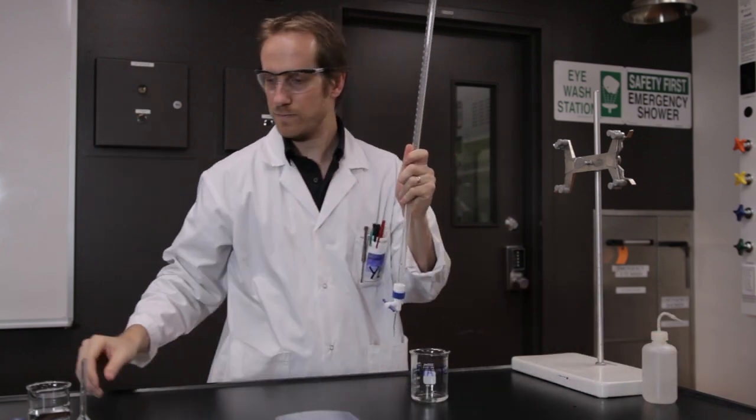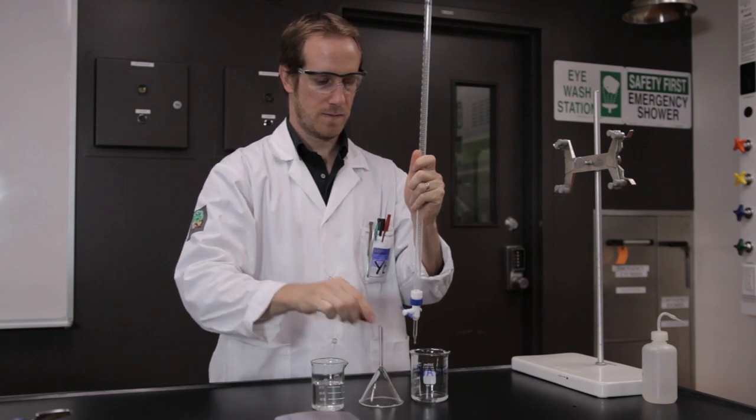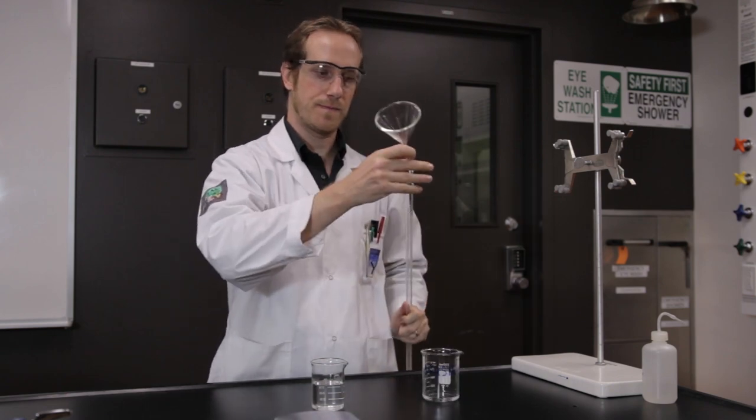Transfer about 100 milliliters of sodium thiosulfate solution into a clean, dry beaker. This is considered your stock solution.